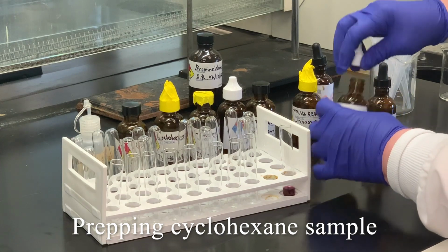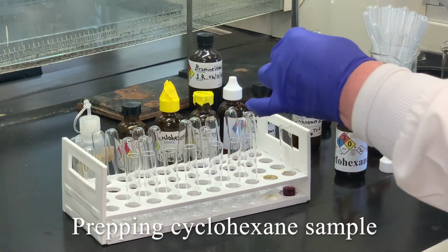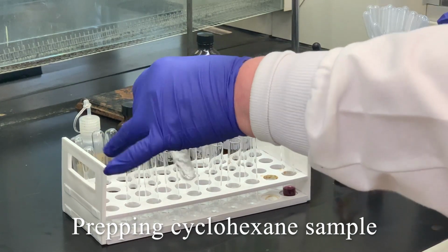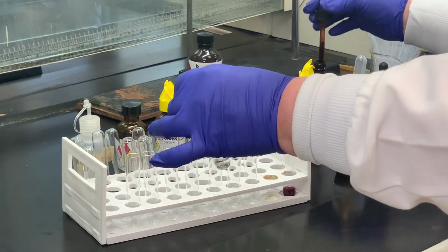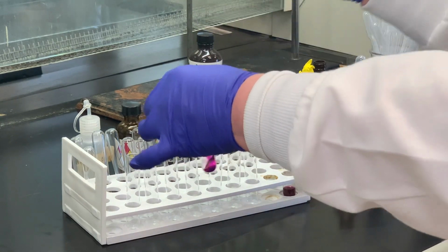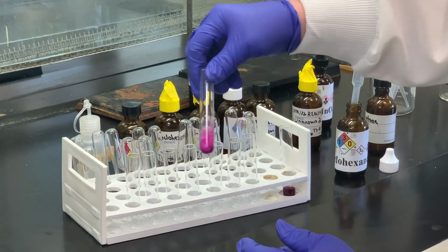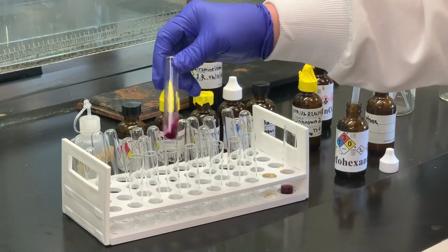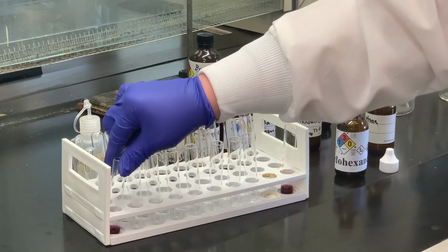First substance up for testing is cyclohexane. Add a couple of drops of that. Swirl it to make sure it's dissolved. And then we'll add a drop of that potassium permanganate solution. And you can see it has that purple color. So there's no change in the purple color. So that would be negative, meaning there's no carbon-carbon double bond there.